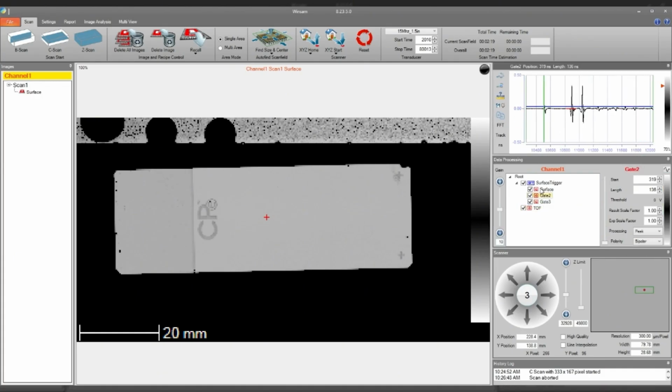We can also do an X-gate analysis. So in the X-gate, we can take this entire gate of time and chop it up into very small slices. And within those slices, we can capture additional information about where voids are occurring within the entire adhesive thickness itself. And so this is really cool because we can see essentially a time lapse of the bond uniformity and where the voids are occurring within the entire thickness of the adhesive.